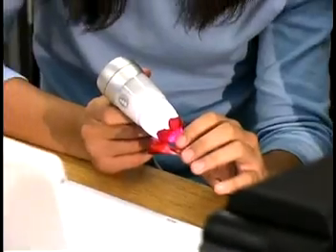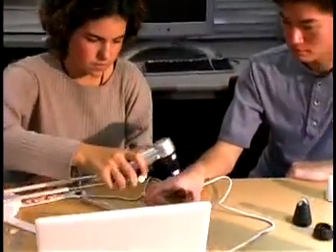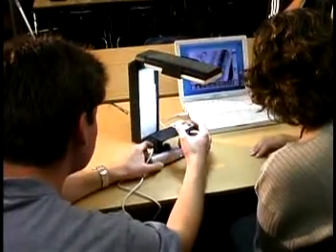We have a choice of using the handheld microscope in 3 different fashions. We can hold it by hand. We can mount it on a tripod or on a device that will hold it for us. And we can turn it upside down and put a flat stage on it. And each one of those becomes a different tool. So if we wanted to look at a prepared sample, we're going to use the stage.